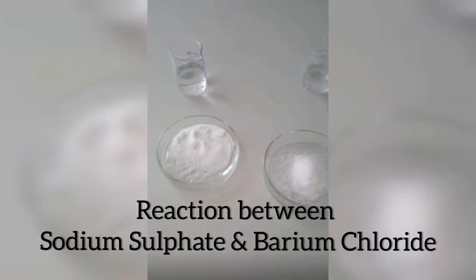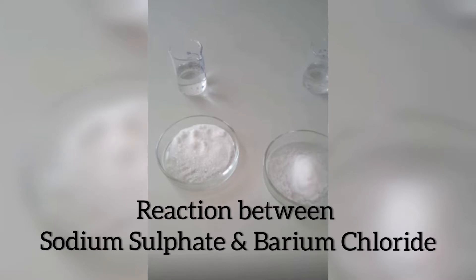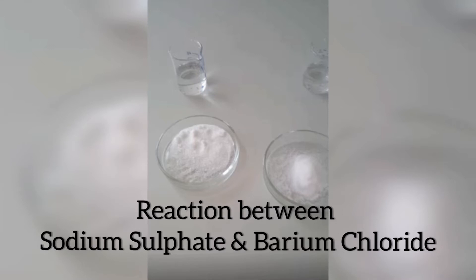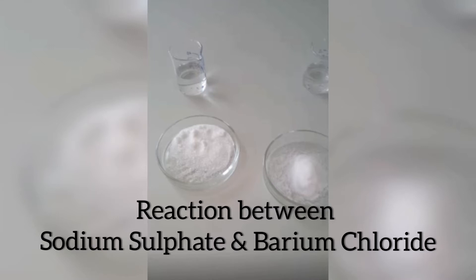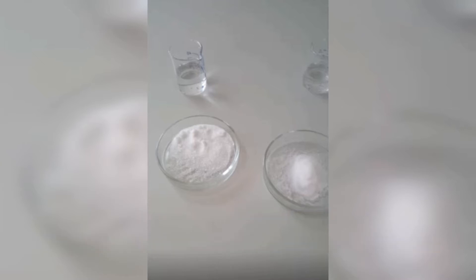Welcome to the video lecture series of grade 10 chemistry. Today we will watch an experiment on sodium sulfate and barium chloride. In the previous videos I have uploaded experimental videos of reactivity of different metals with dilute hydrochloric acid and what happens when zinc reacts with dilute HCl. Today we will observe this experiment on sodium sulfate and barium chloride.